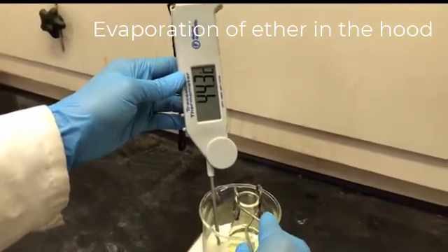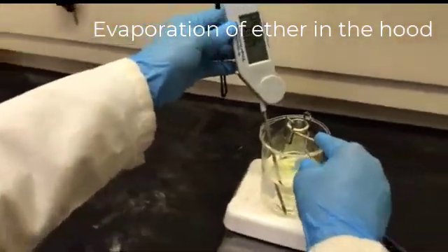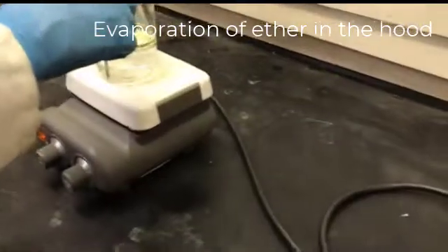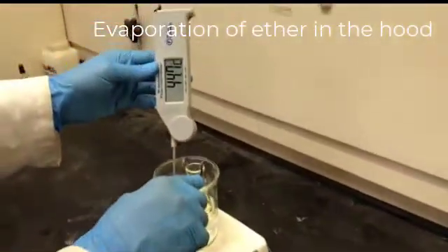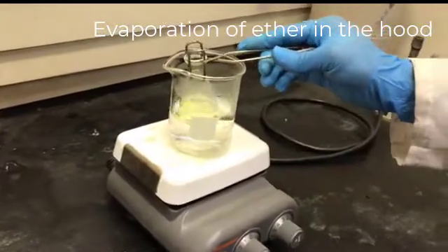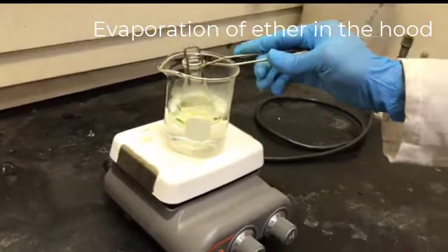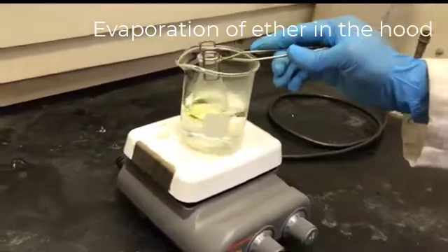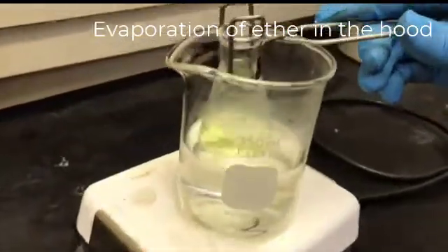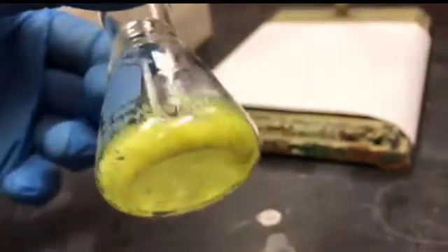Make sure the temperature of the water bath is not too high. Make sure you perform this evaporation step of ether in the hood, because ether is a toxic compound. The ether is evaporated, and now these are the crystals of the neutral compound.